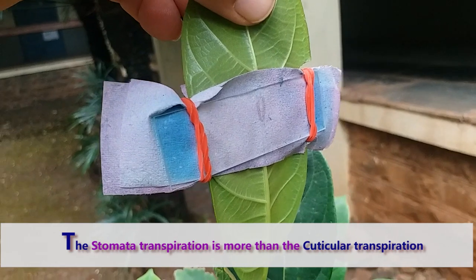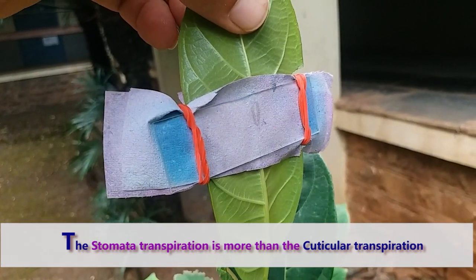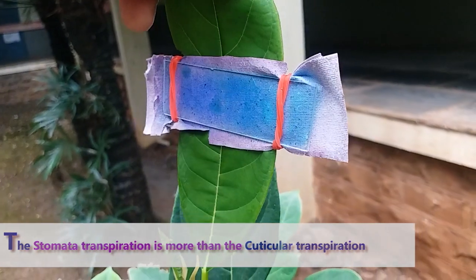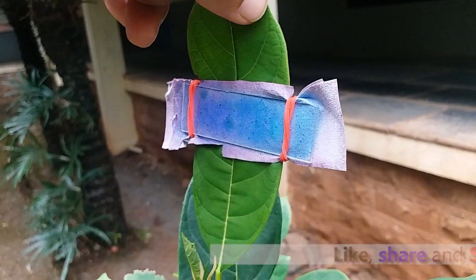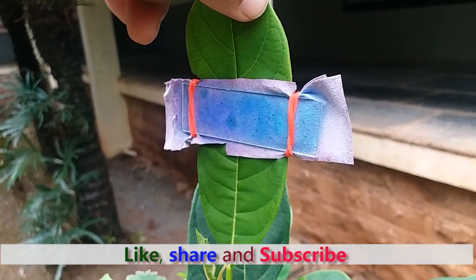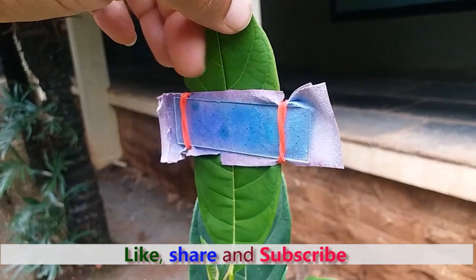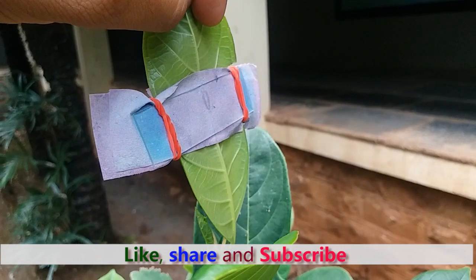Stomatal transpiration is more than cuticular transpiration. In this way, by using cobalt chloride paper, we can determine and compare the rate of stomatal transpiration and the rate of cuticular transpiration. Thank you.